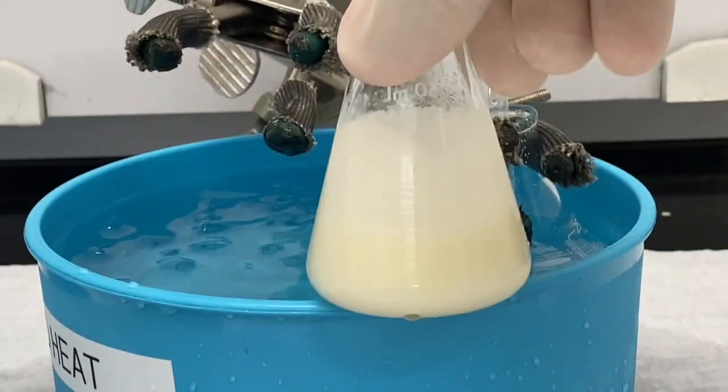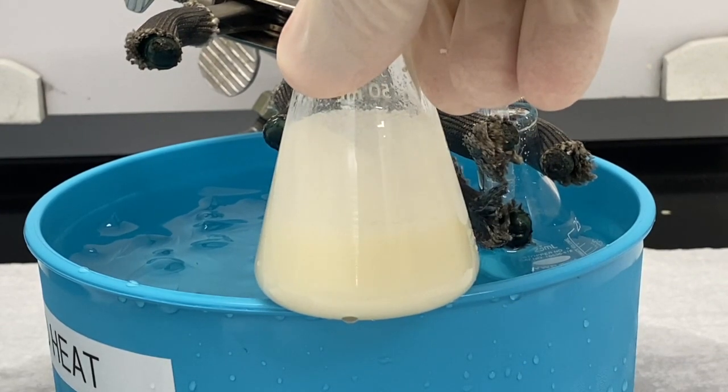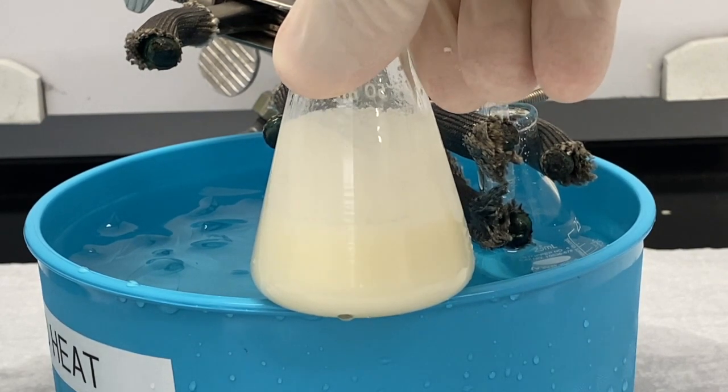And this is what it looks like after the first five minutes. And I'm just going to stir this off screen and we'll come back to when we add the ice to stop the reaction.